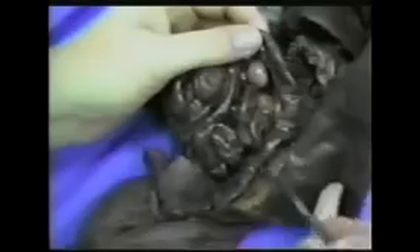The next section of the small intestine, which I will not use on the practical, is called the jejunum. It's just about three or four inches long in this animal and is indistinct and hard to label. The remaining coils of the small intestine are called the ileum — a huge amount of ileum. The ileum continues until it reaches the ileocecal valve. The colon in this animal is not like the human colon; it's just right here — this is the whole thing, the entire large intestine. At the base of that, we have the rectum, and the undigested products exit by way of the anus.